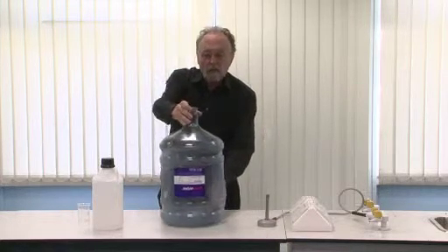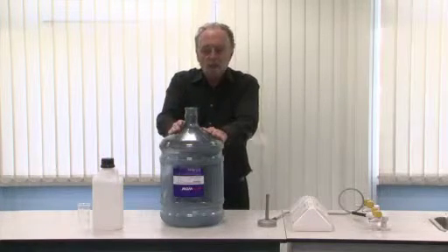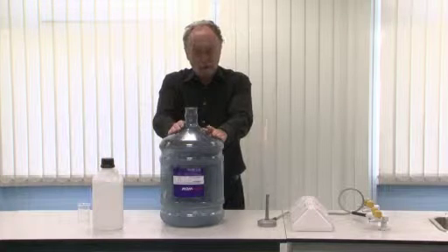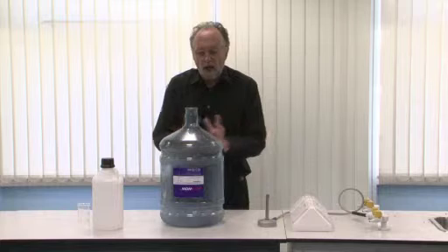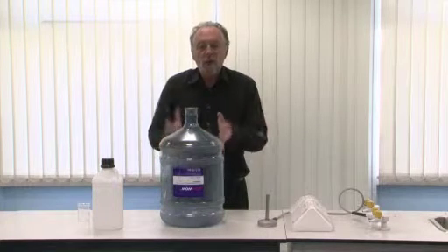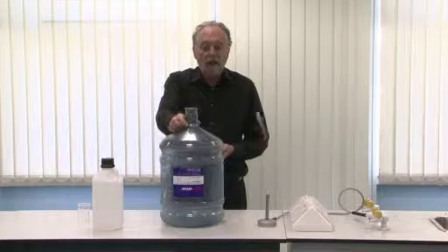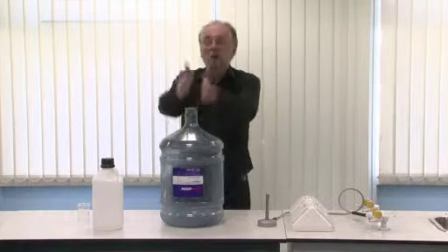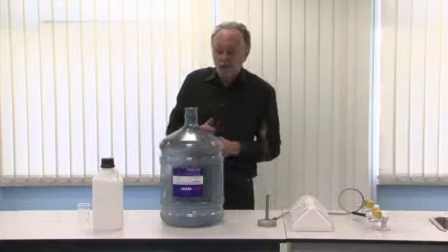Now there are a few safety issues with this experiment. The bottle is made of polycarbonate, and polycarbonate is what they make riot shields from, so there's very little danger in terms of an explosion blowing the bottle apart, particularly since the top of the bottle is open and the gases which are produced are funneled directly upwards. Perhaps best to remember not to do this directly underneath a light fitting.